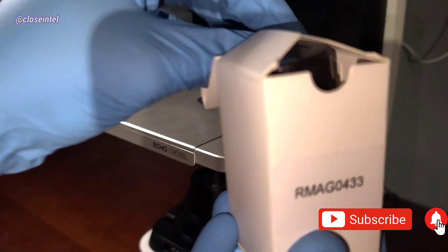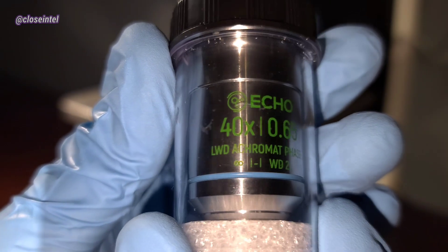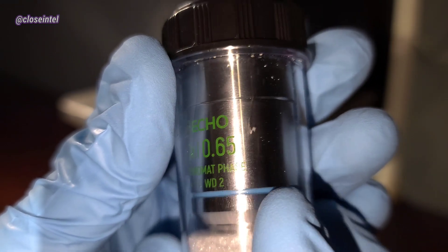I just got this objective in the mail from Echo. It's a phase contrast, long working distance, 40x objective. It will allow me to see bacteria pretty easily.